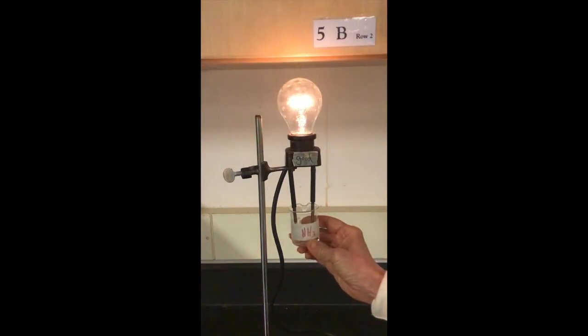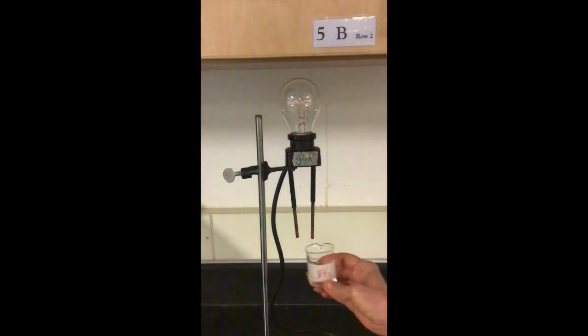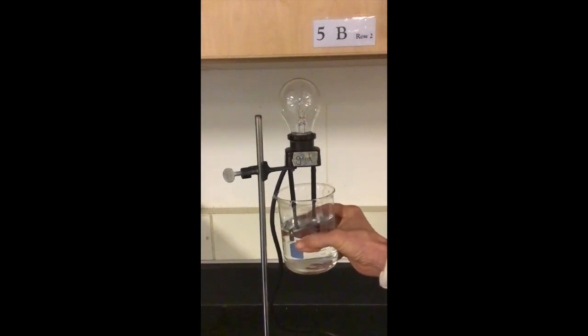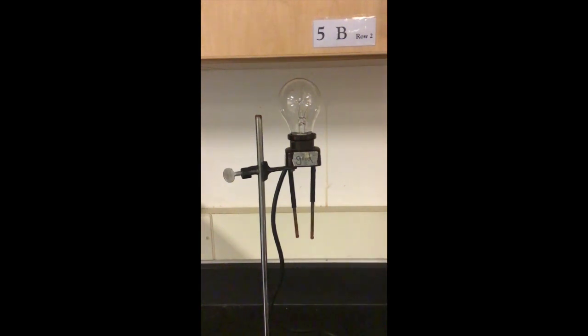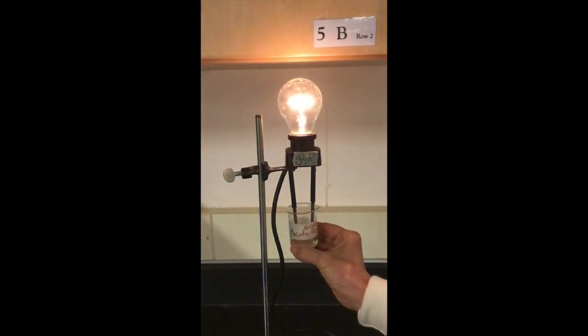NH3, ammonia, aqueous solution. Acetic acid.